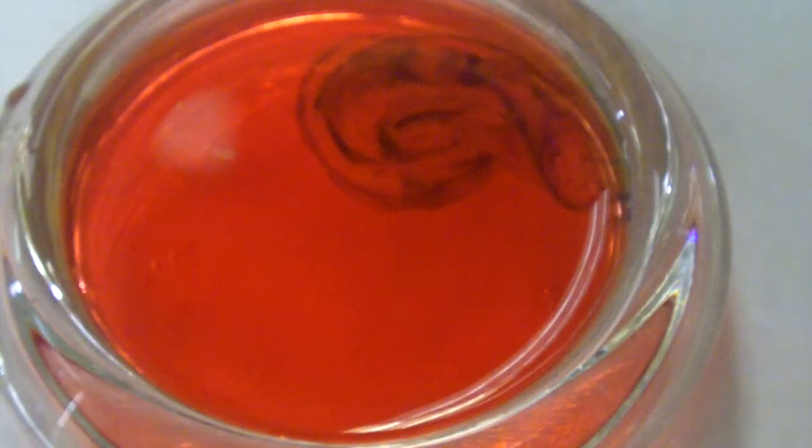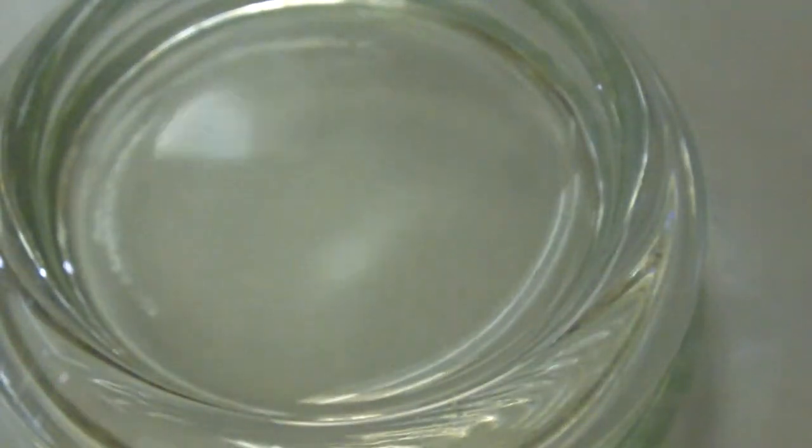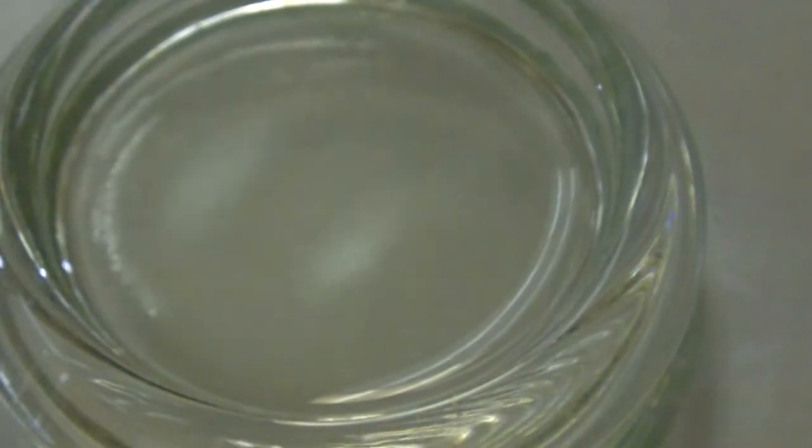The next test utilizes the next solution, potassium iodide, cleaning off the pencil electrolysis electrode tips, pencil lead in other words. Move this solution out of the way. Looks like a little spilled. Bring in the potassium iodide. For this one, we're doing two tests: first, without the phenolphthalein indicator, and then with the phenolphthalein indicator.